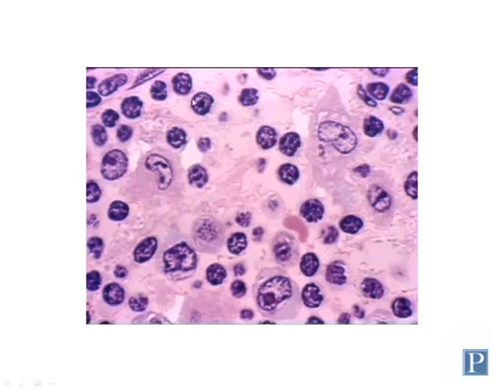Plasma cells are differentiated lymphocytes, which is a type of leukocyte that we're going to discuss later on. These cells are responsible for producing and secreting antibodies to help neutralize infectious agents. And here you can see many of them that have been recruited to this tissue because of a local immune response.